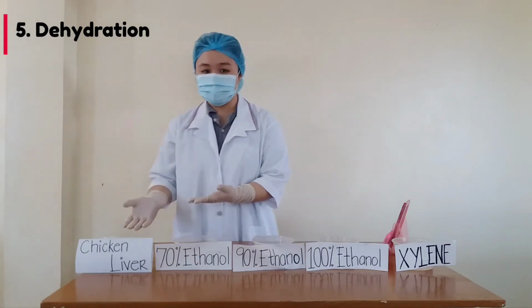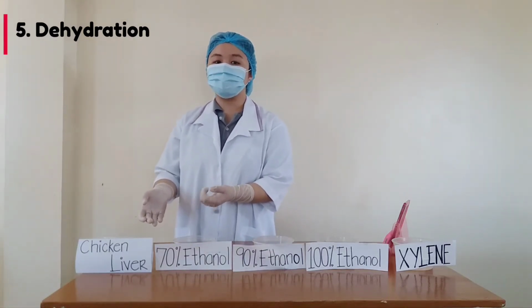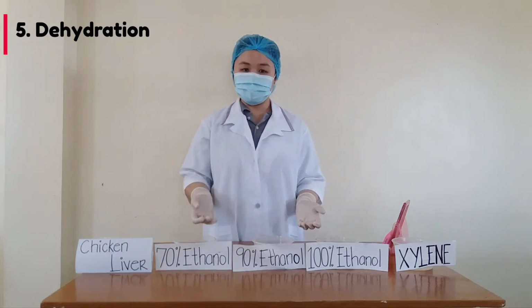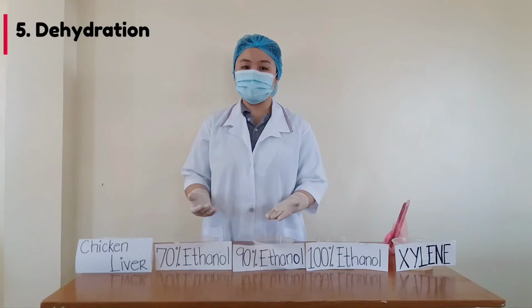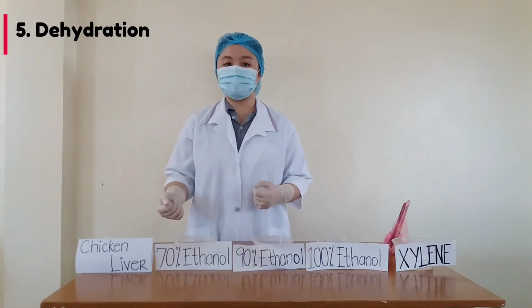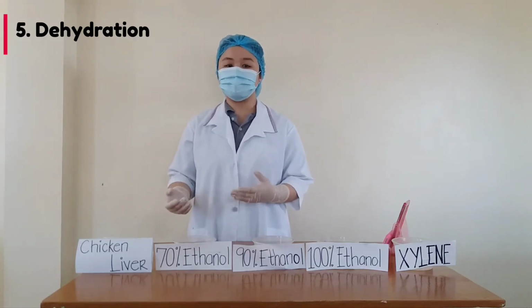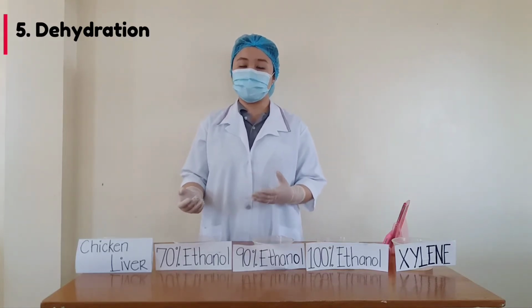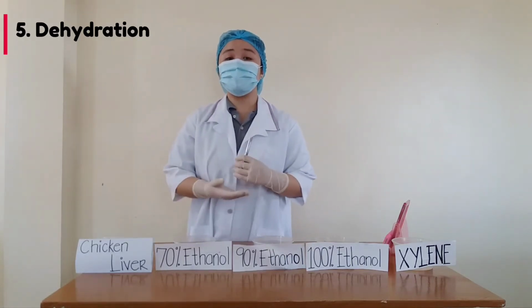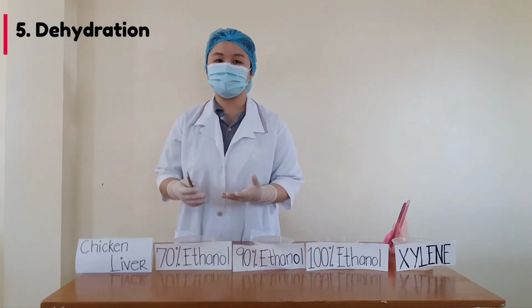We have our specimen, which is the chicken liver, that was submerged in vinegar for the fixation process, and our increasing concentrations of alcohol: 70%, 90%, and 100% ethanol. After we submerge the specimen in the vinegar, we will now place it in 70% ethanol for 30 minutes to start the dehydration process. Using our laboratory forceps, we can pick up the specimen to transfer it to the solution.